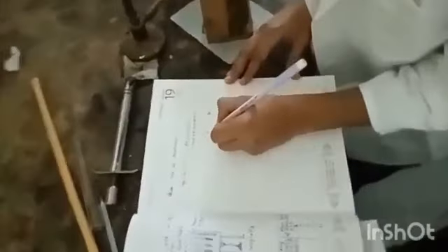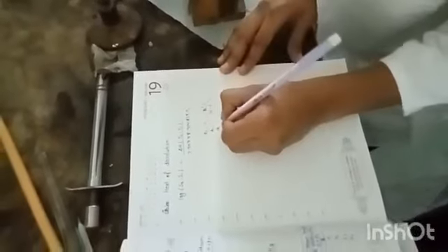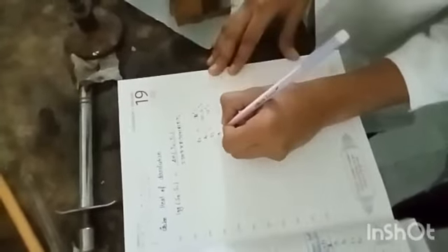Now we calculate the heat of dissolving. T1 is 74 degrees Celsius, T2 is 75.3 degrees Celsius, T3 is 76 degrees Celsius, and T4 is 77 degrees Celsius. Now we will convert it into Kelvin.